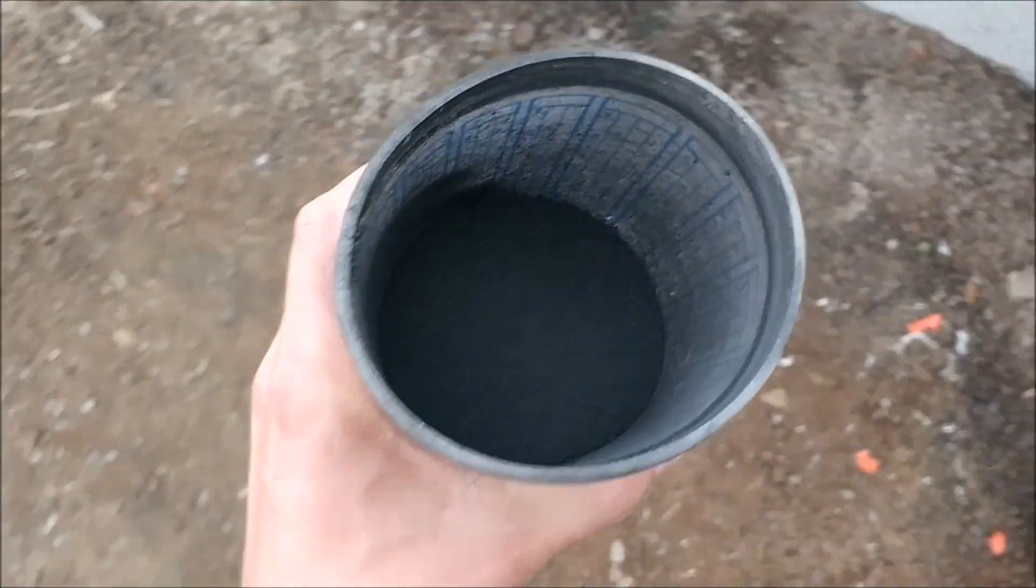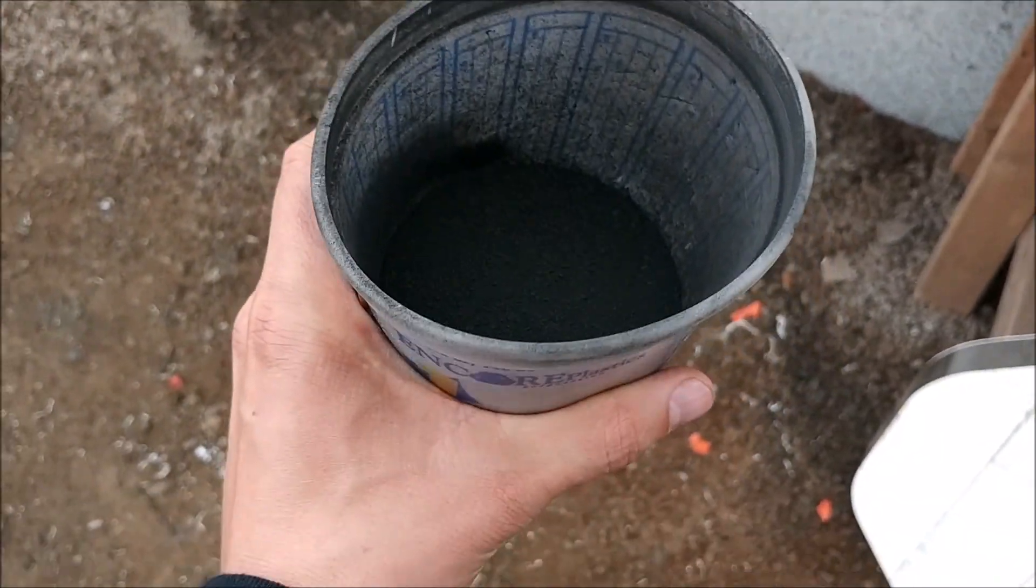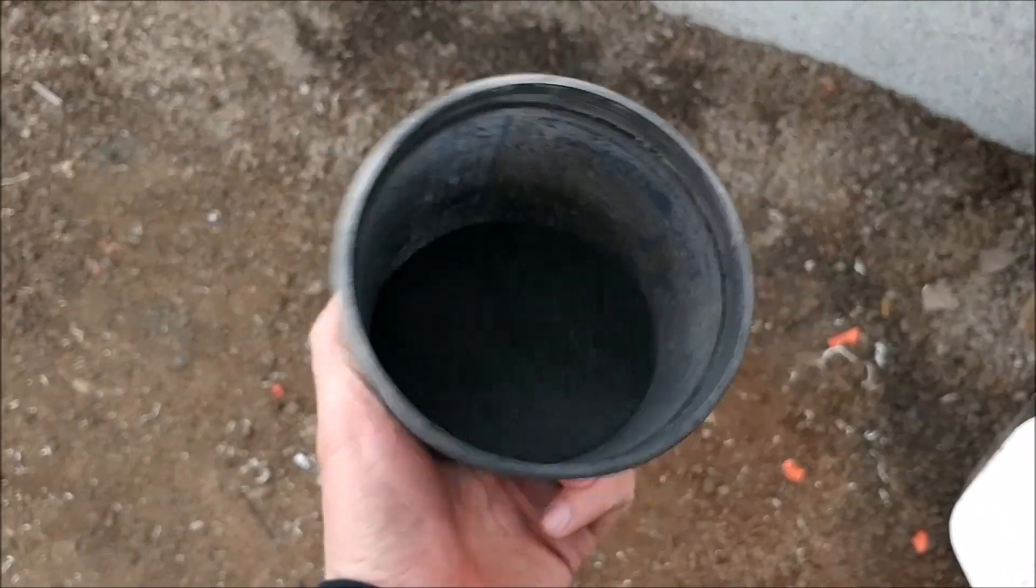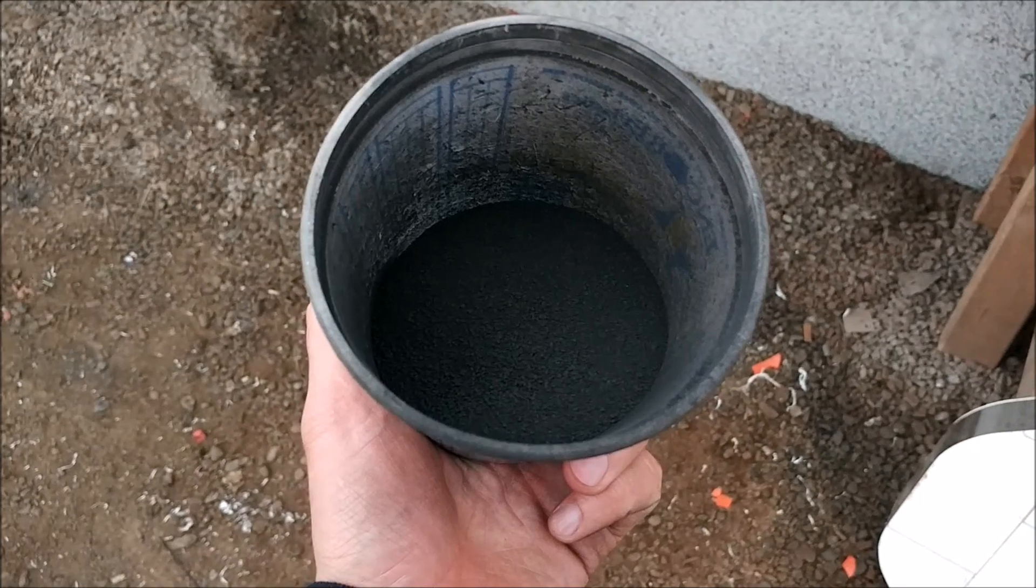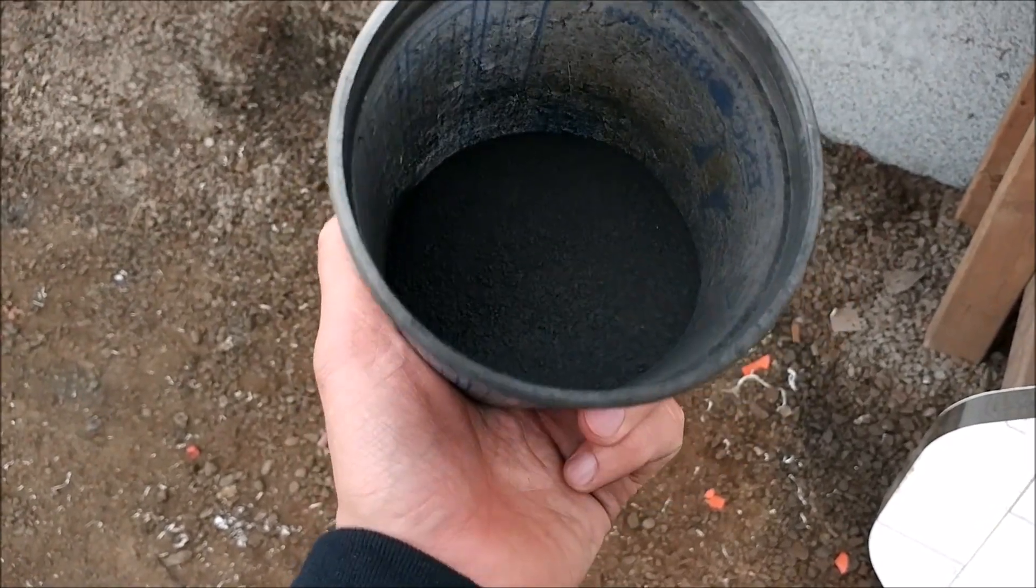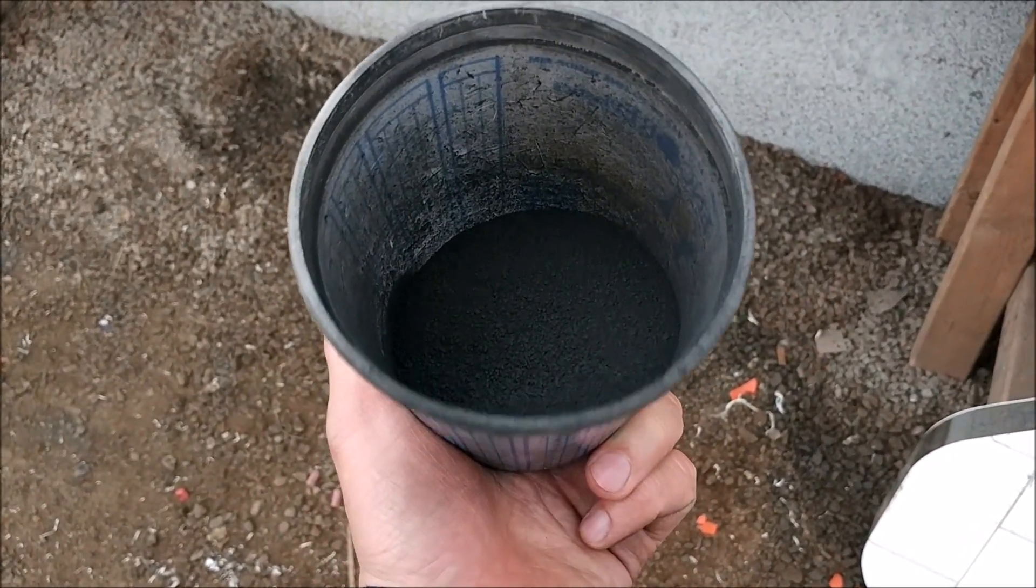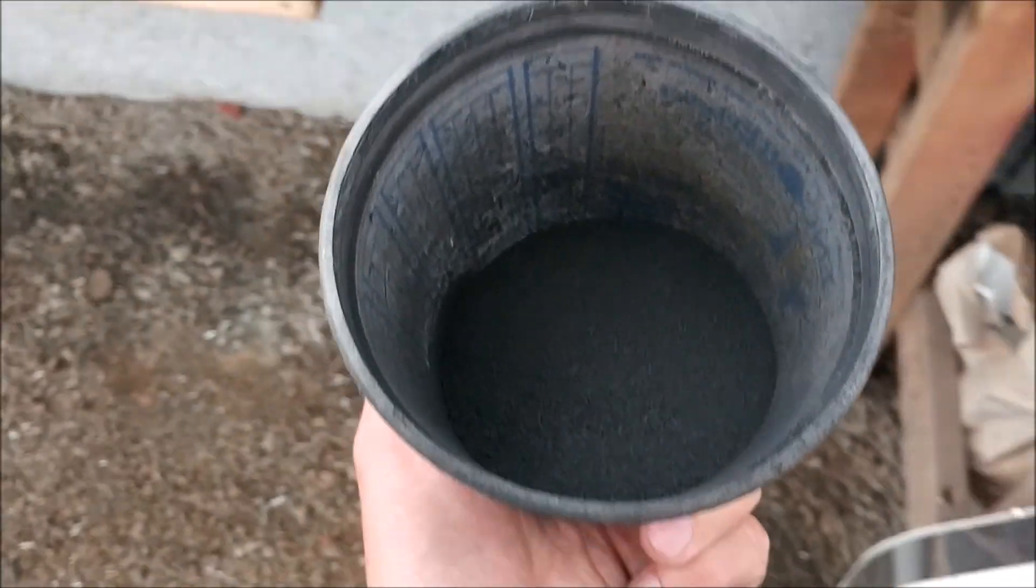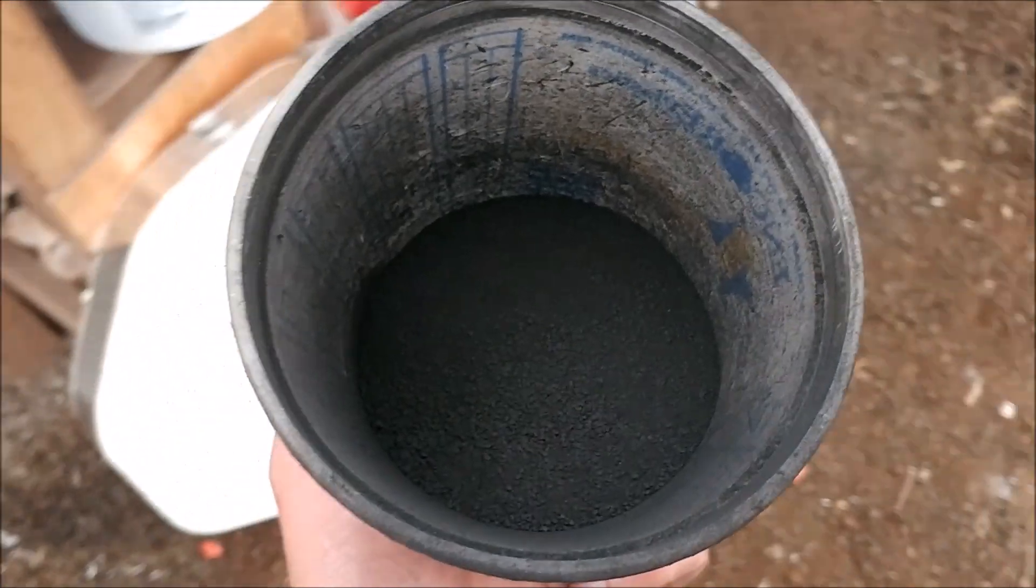So I'm running out of material, I've got about 150 grams or so left of the ore, and I wanted to try something a little bit different. Rather than adding a collector metal or iron, I mixed 50 grams of the shaker table concentrates with 300 grams of Chapman Flux and then about 100 grams of borax to help thin it.